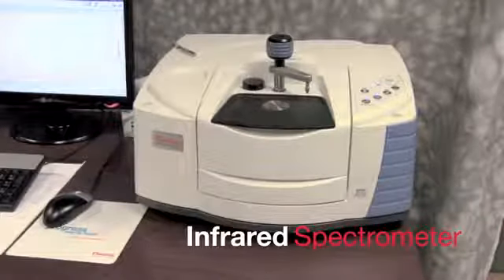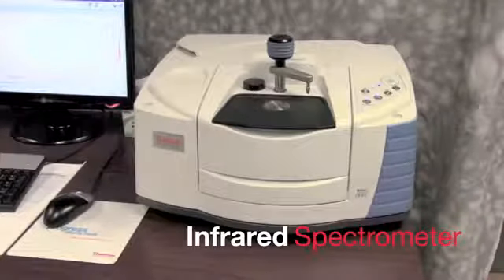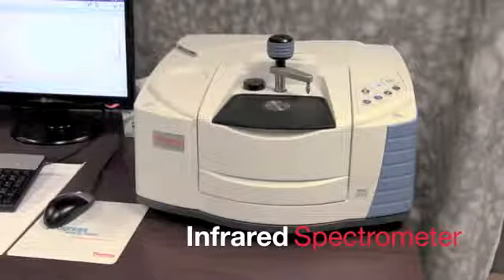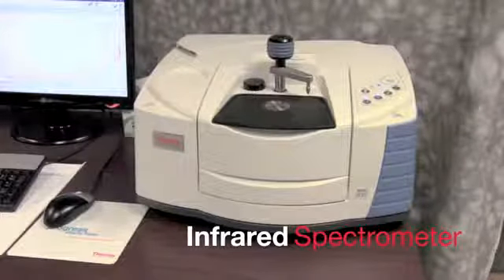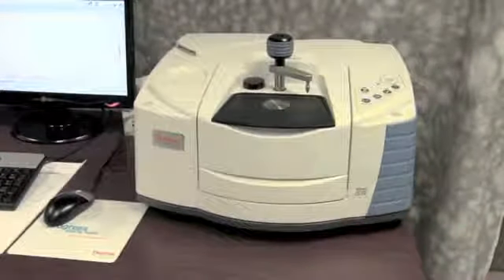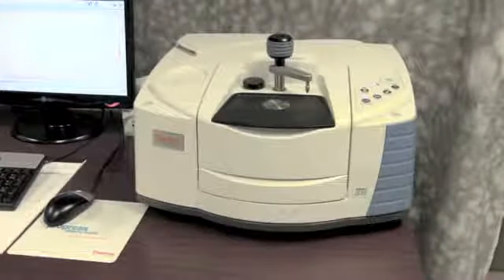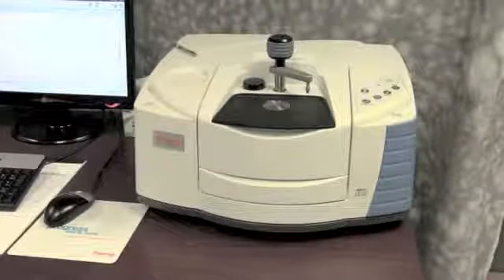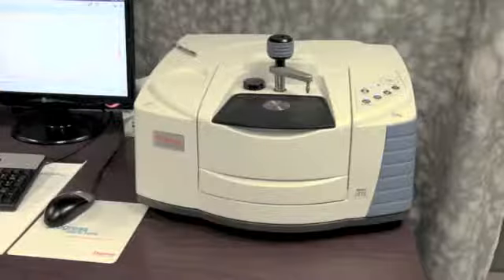This is the infrared spectrometer. It has an infrared light source that is the baseline of the energy. And what happens is a sample is put into that light source, and then the absorbance of that sample is what is used to measure the bonds of the carbon atoms.